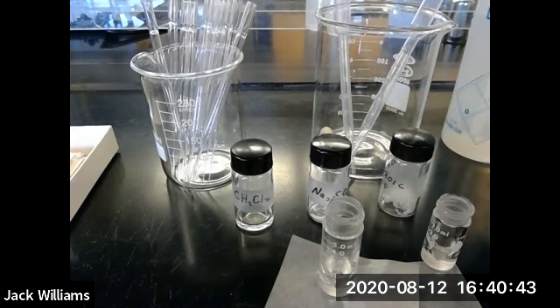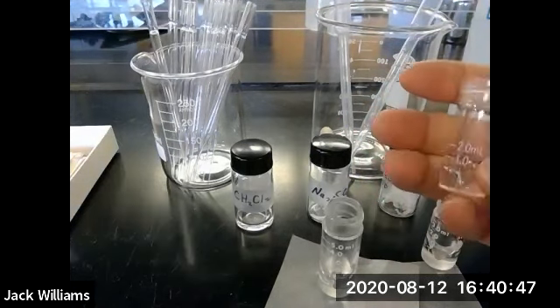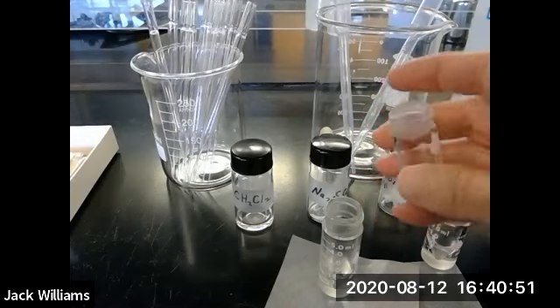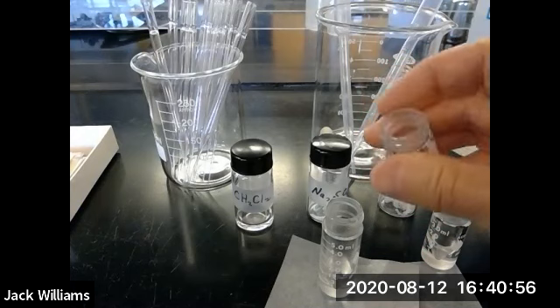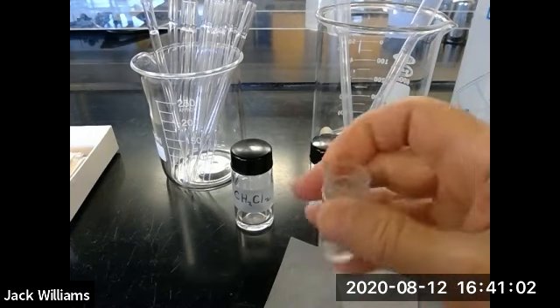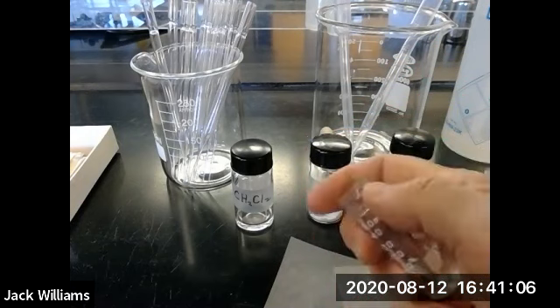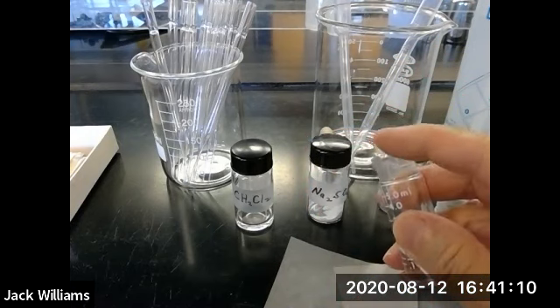What do I have here? I got this one here. I guess they don't have the 3 on there, just the 2, but it's still a 3 ml vial. Now check these to make sure they're not chipped. I usually check the lab beforehand, but if one has gotten away from me, just look at the top of this, and you see how that's chipped there? It's a little chip mark on that. Now that's not sharp enough.